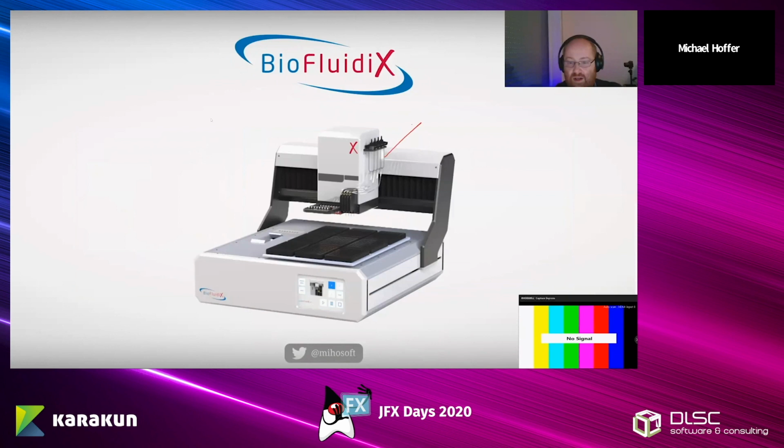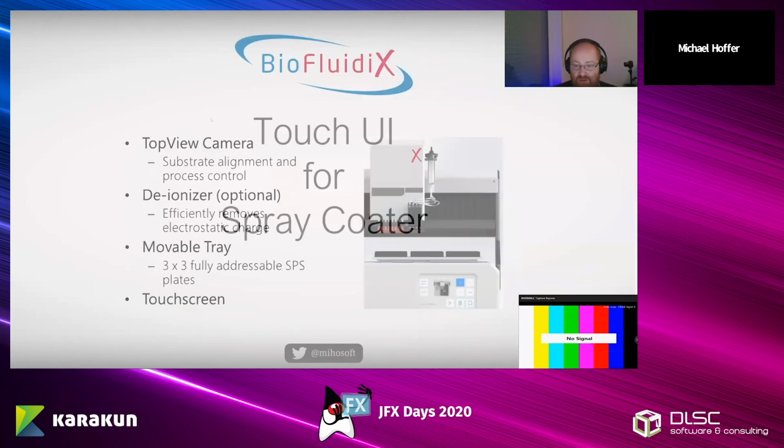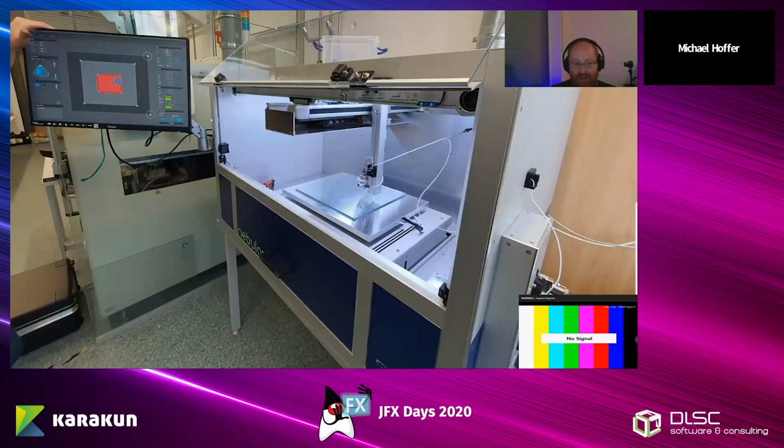Okay, this is the machine that we currently ship. Here is the media, and here it is dispensed out of those pipe jets. And as you can see, there is a user interface that is touch-based. And as you might have guessed, previously it was not JavaFX based, but the good news is that the new machines are JavaFX based. I won't go into detail what this specific machine does because the user interface is for a different one. But the takeaway point is that it is close to the hardware, and we need to control sensors and actuators. And the user interface should be touch-based and easy to use. So the touch user interface for the so-called spray coater that we designed looks like this. So this is the machine. It is located at the University of Freiburg.